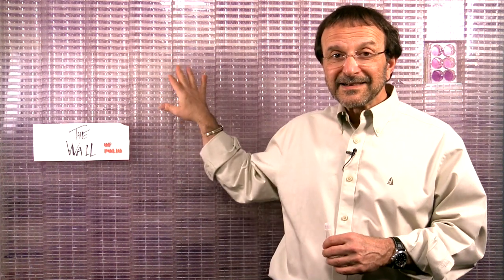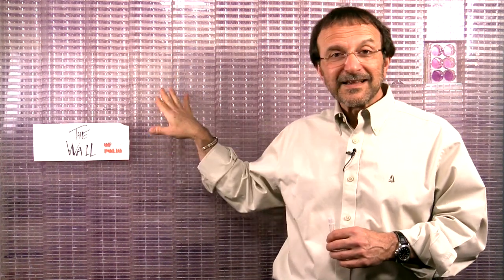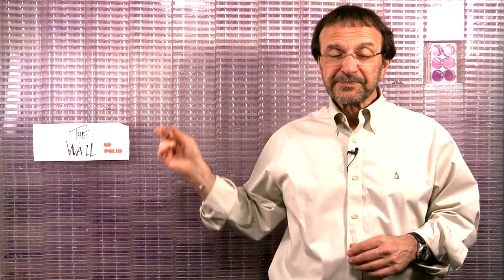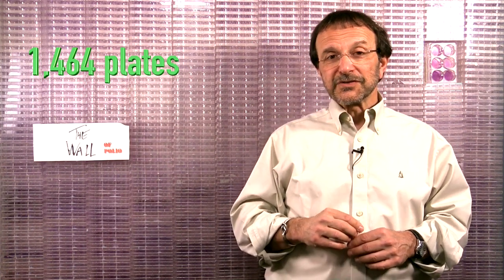In fact, this wall that you see behind me in these videos — I call it the wall of polio — is a stack of six-well plates that we have used to measure the titer of poliovirus. This wall is made up of 1,464 plates that were used for a single experiment done over the course of two weeks.